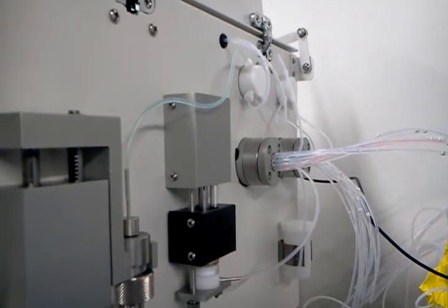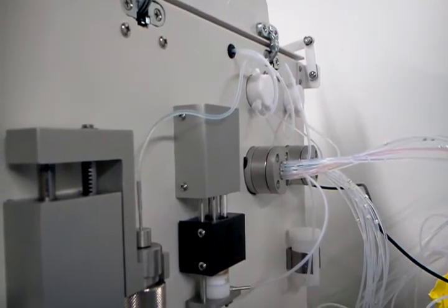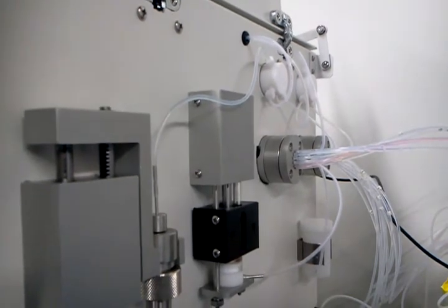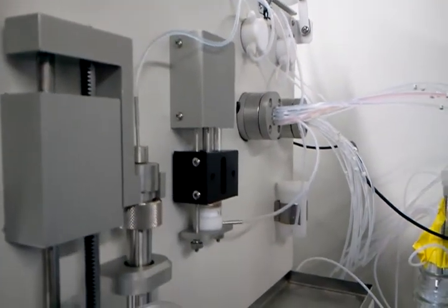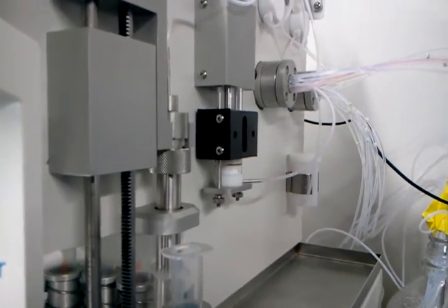The one mil is going to be pulled completely. The sample has been delivered to the head of the column and normal operations that we continue on with are a wash and an elution.